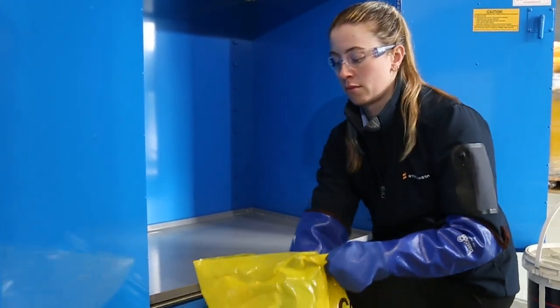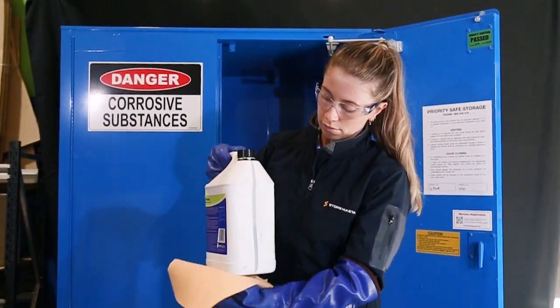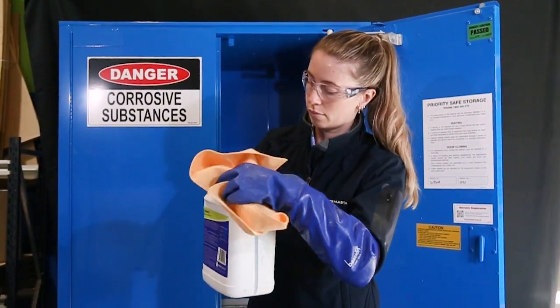Wipe down the walls, shelves, ceiling and any other parts of the cabinet that may have been contaminated. Before returning the chemical containers, bottles or other packages to your cabinet, wipe off any residue and check the containers for leaks or damage. Ensure all packages have lids and are closed firmly. Discard any damaged or leaking chemical bottles or containers, as well as the chemical waste disposal bags or containers in accordance with recommendations of the EPA, Health Department and your local waste authority.